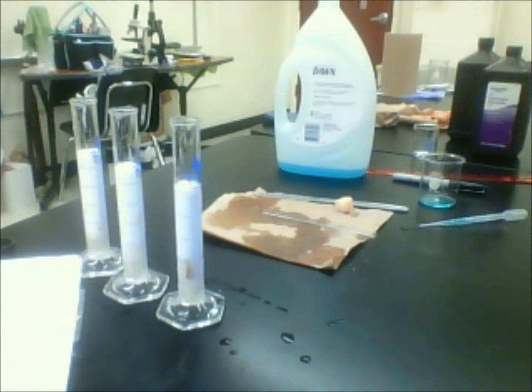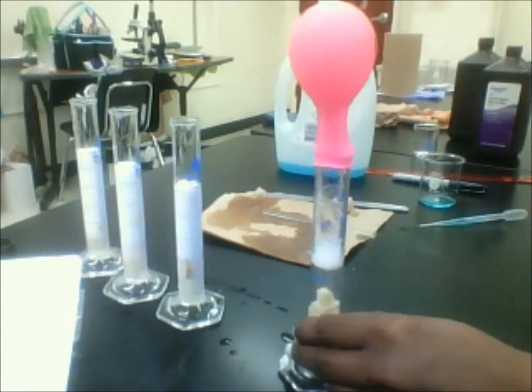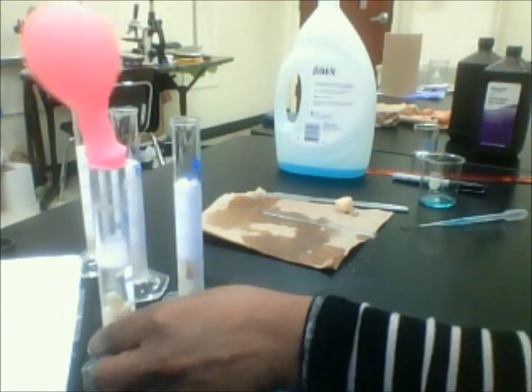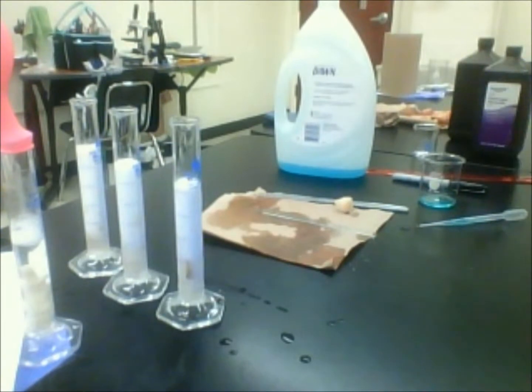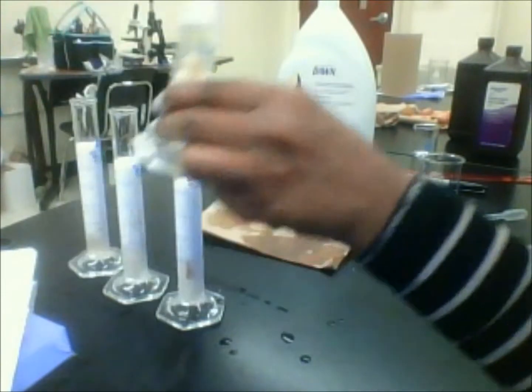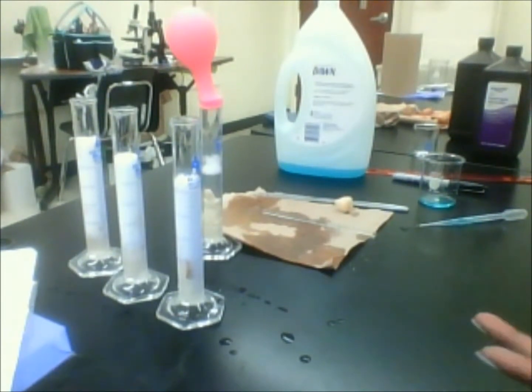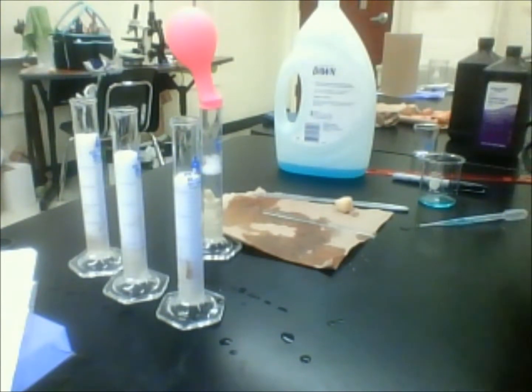Okay, and while we're waiting, this is just another extension that I do. Now, this I've had sitting all day. And this is just a graduated cylinder with the potatoes in it, the hydrogen peroxide, and a balloon. I put just a little balloon on top of it. And again, the oxygen gas that was produced was able to blow up the balloon. So the same setup, I did nothing different, but the gas was used to actually blow up the balloon. And that's just another extension, something you could do and see which balloon gets the biggest. You can actually measure the circumference of that balloon.